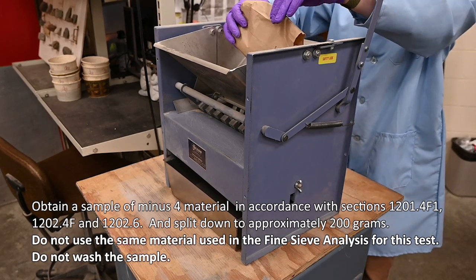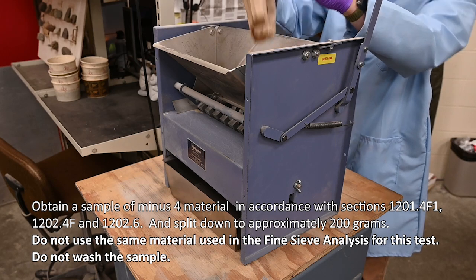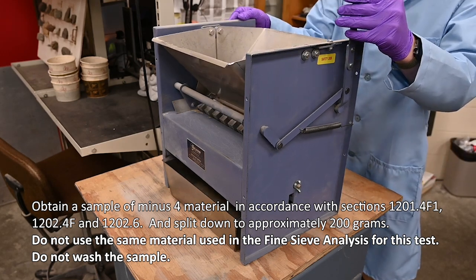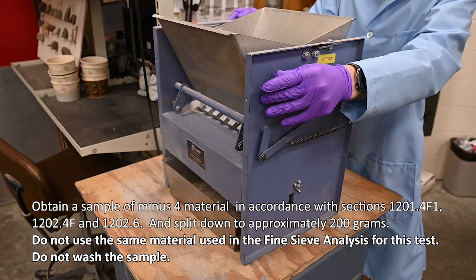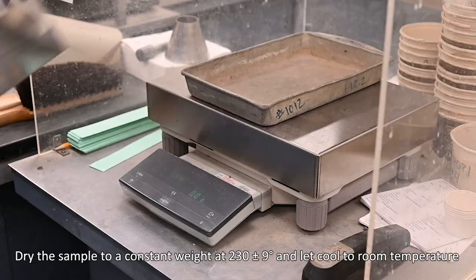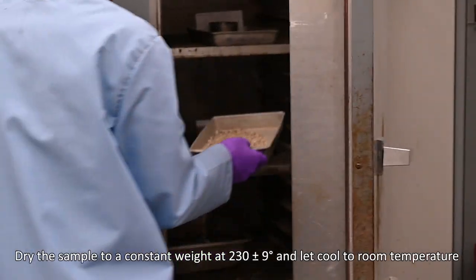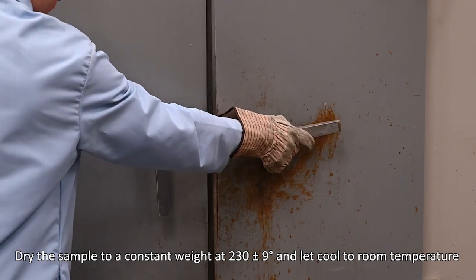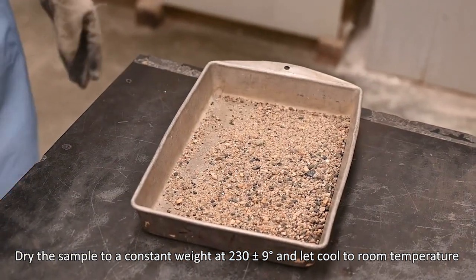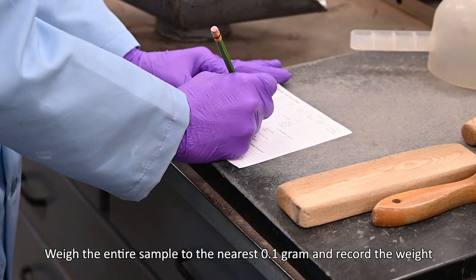Obtain a sample of -4 material in accordance with sections 1201.4F1, 1202.4F, and 1202.6, and split down to approximately 200 grams. Do not use the same material used in the fine sieve analysis for this test, and do not wash the sample. Dry the sample to a constant weight at 230 degrees, plus or minus 9 degrees, and let cool to room temperature. Weigh the entire sample to the nearest 0.1 gram and record the weight.